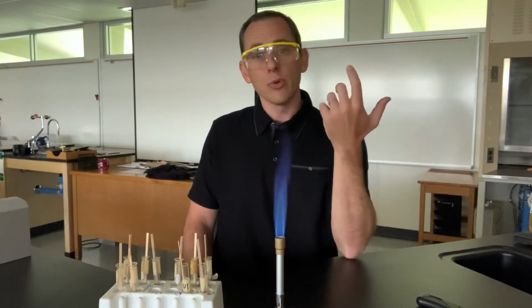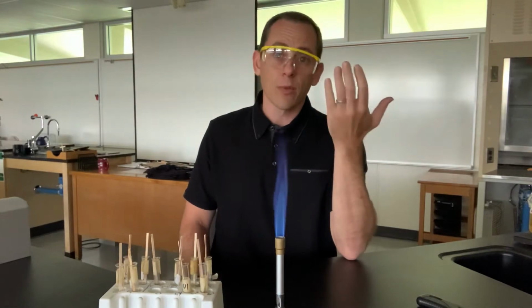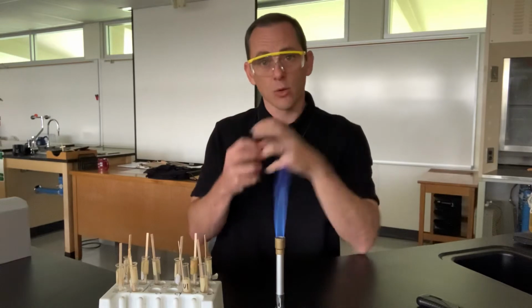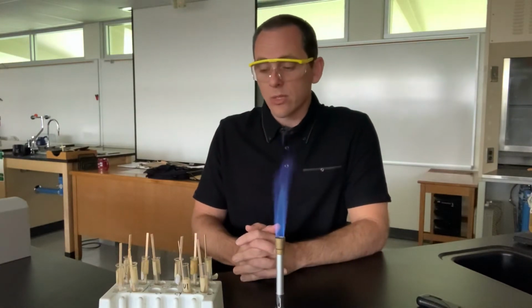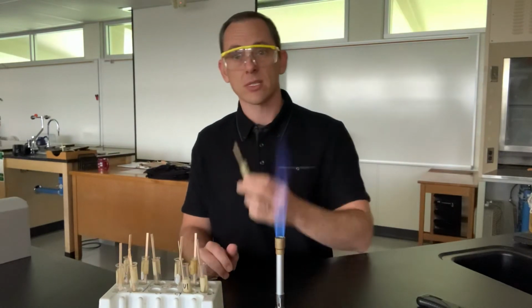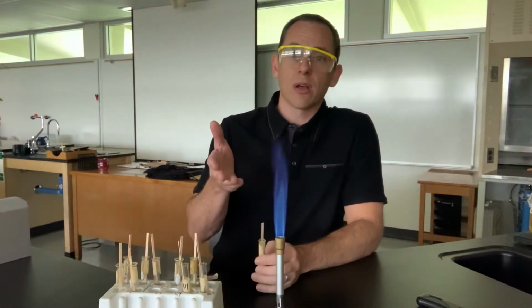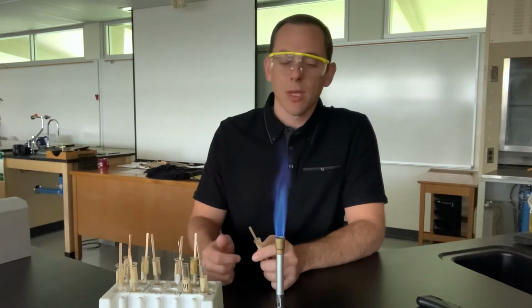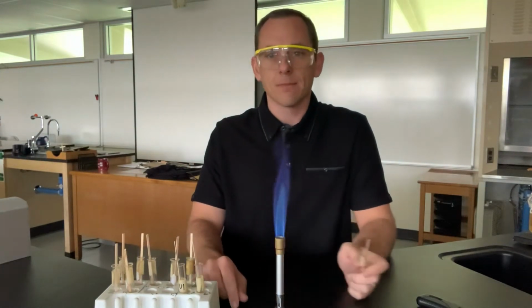So as I go through these, I'll let you know what element we're observing, and on the lab paper that you're taking your recordings on, you're going to basically say, this is barium, so we'll do barium first, and when I put it on fire, I'll let you know when I see the color actually. Sometimes it takes a minute to heat up, and you're going to record the color that you see.